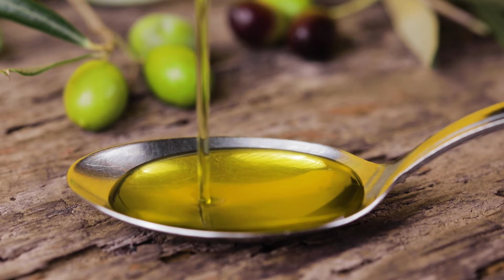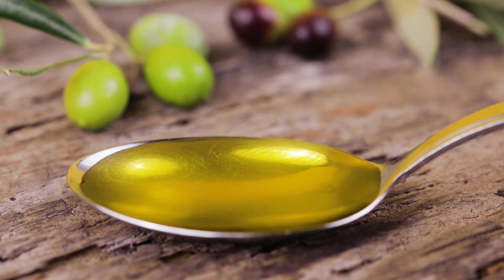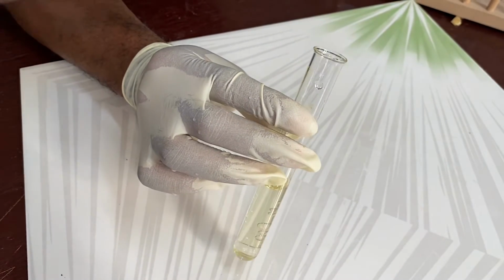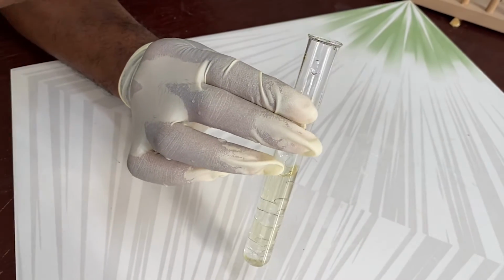In today's lab, we will be testing specifically for unsaturated fat. The principle behind this fat test is that since unsaturated fat molecules are non-polar and water molecules are polar, they will not mix. To carry out this test, we simply combine a sample of oil with water. If the samples do not form a solution, then unsaturated fat is present.